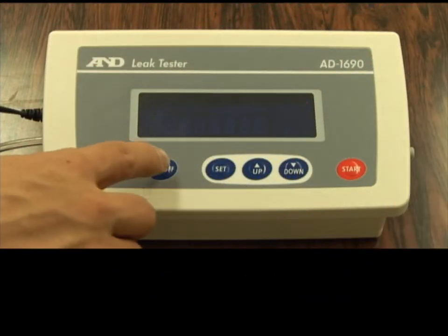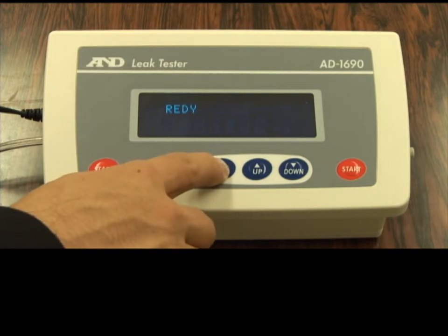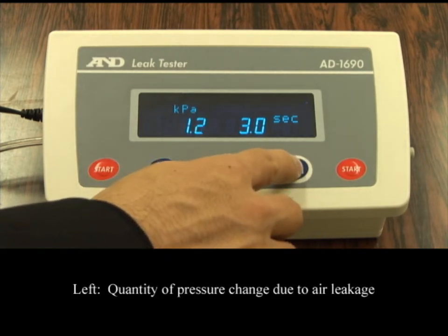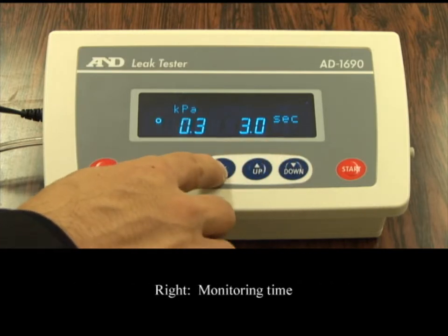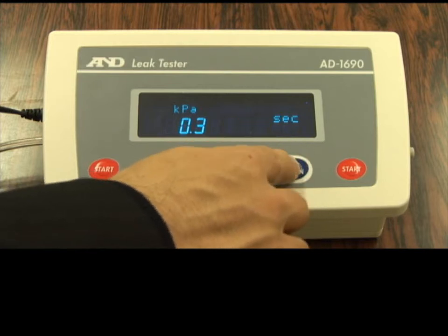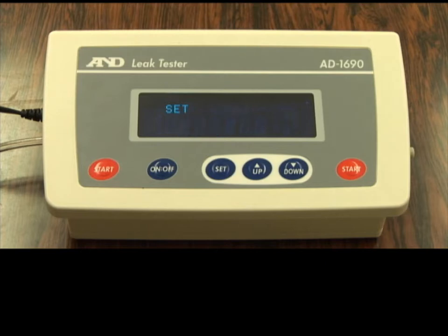Now press the on-off key. The AD1690 displays its settings and then enters standby mode. The settings are the judgment criteria for the leak test and can be changed if necessary. The figure on the left indicates the quantity of pressure change due to air leakage, whereas the figure on the right indicates the monitoring time. The AD1690 displays either pass or fail depending on whether the quantity of pressure change exceeds the set value during the set monitoring time.